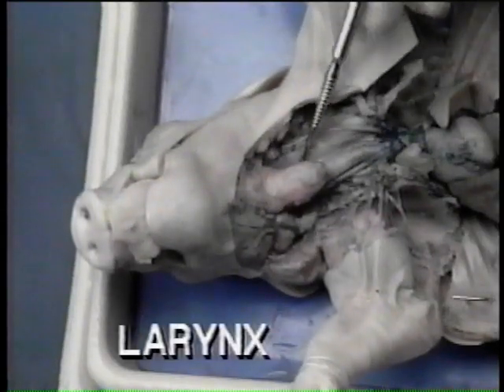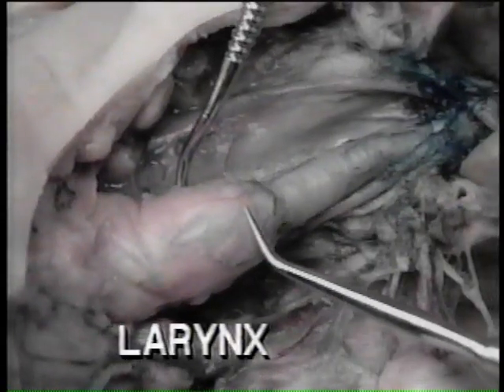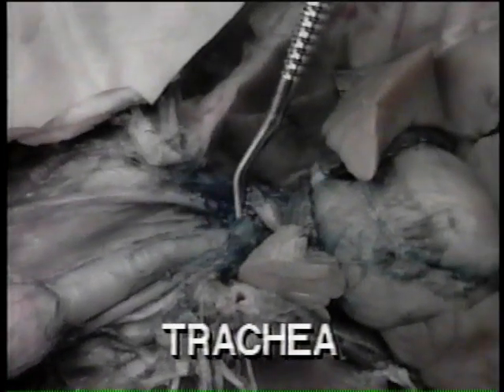The larynx is made of 4 cartilages, the largest being the thyroid cartilage. The trachea continues from the larynx to the lungs through its branches.